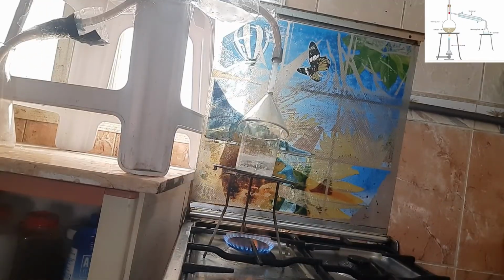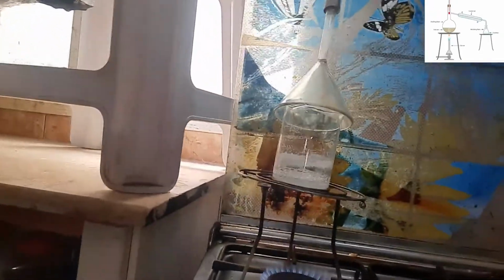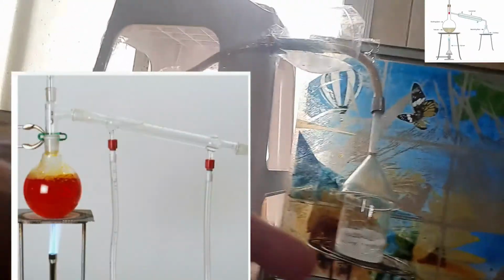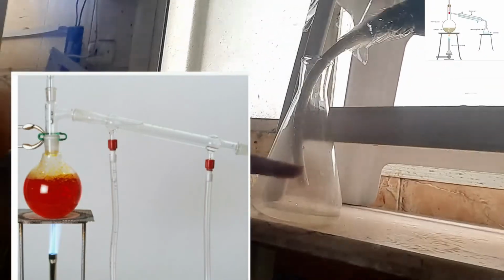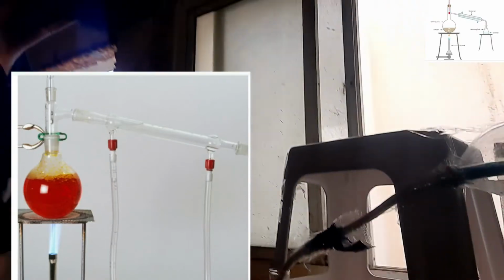The procedure is nearly going to end. We can find that the salt crystals are there at the bottom of that vessel. Here you can see, if I move the camera a little bit closer, a lot of boiling is happening and the salt crystals are there, and the maximum water has transferred into that container. You can find enough water is there. So this is a simple procedure we have done.